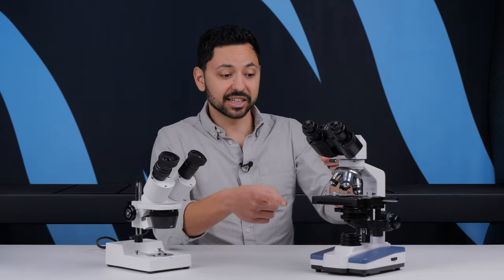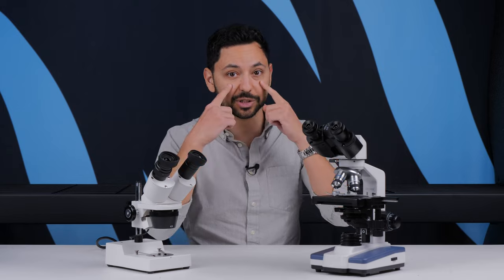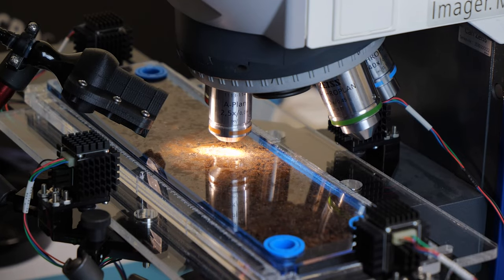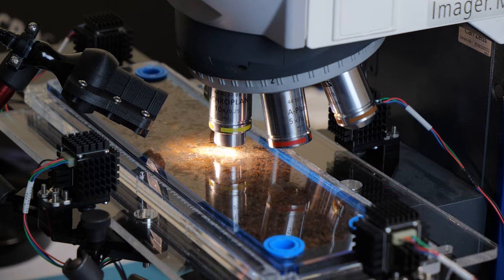But, at least as the case with this microscope, the image that each eye receives is exactly the same. The light's just going through the same objective and it's just a duplicate for each eye.